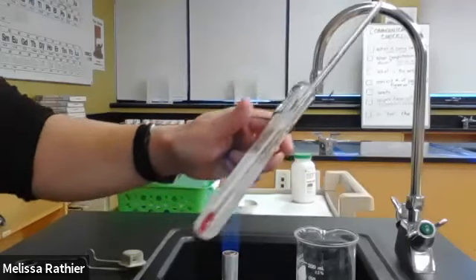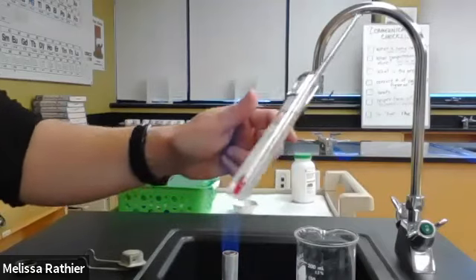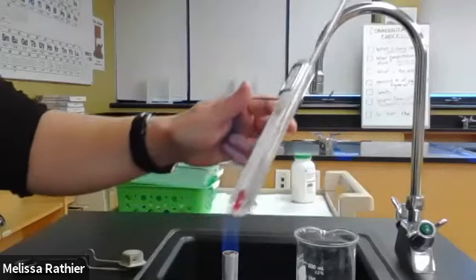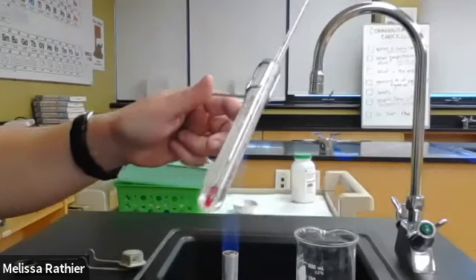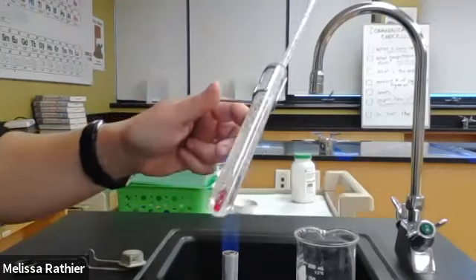Now what we're trying to do here is prepare a solution, a clear, colorless solution where all of the solute is dissolved. What's interesting about this particular solute is that I only put 10 drops of water, but as you can see, the volume of my solution is much more significant than that. So there must be some other water that has been released and is now available to make a solution. That's because the sodium thiosulfate crystals that we're using here are a hydrate.